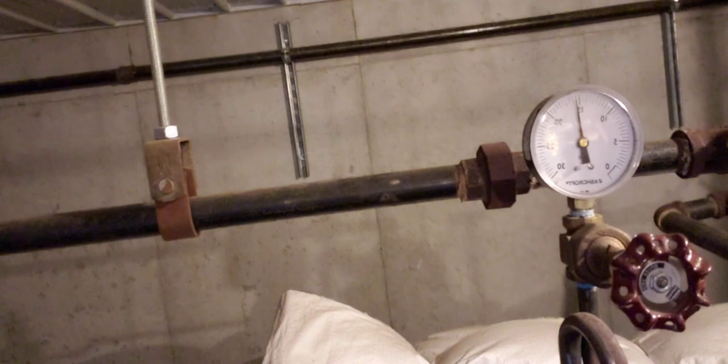Hopefully just about 15 and a half psi. I started at 12 o'clock noon and it is now 3:30. There is a come-up time of about 50 minutes, so I'm at over three and a half hours right now, minus that 50 minutes of come-up time. In a pressure cooker, the come-up time is really fast — let's say 15 minutes. So going back to that 90-minute-at-15-psi thing, I'm over three and a half hours total, so over two and a half hours at 15 psi.